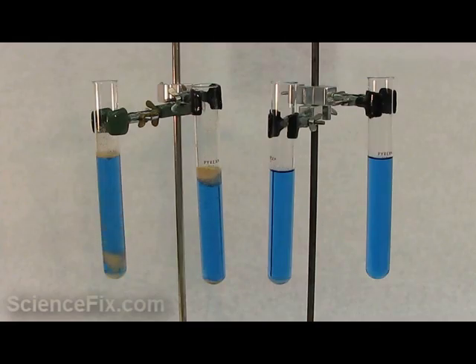Now, what this is to demonstrate is that yeast cells can do cellular respiration. They can take the sugar and, if there's enough oxygen, they can react it with the oxygen to release energy.